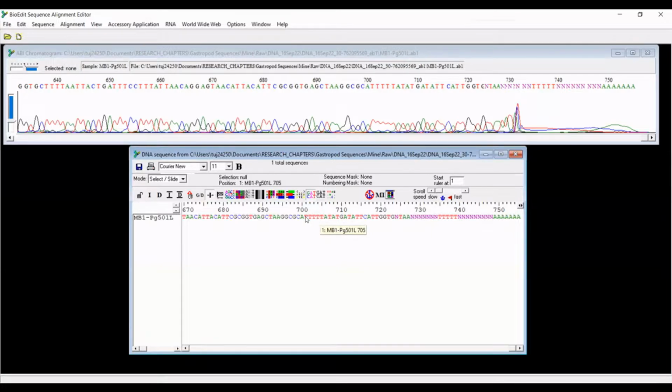Okay, so what we're going to do is I actually don't want anything after this point. So after 701 bases, I just want to trim that right off because this is pretty low quality and it won't help me in my analyses. And so the first thing you want to do is identify this mode here. Right now it says select/slide.